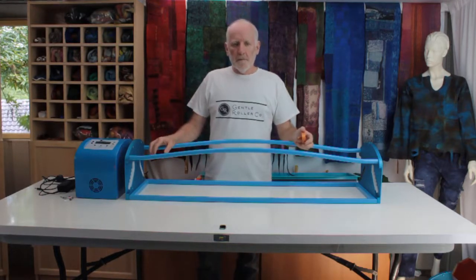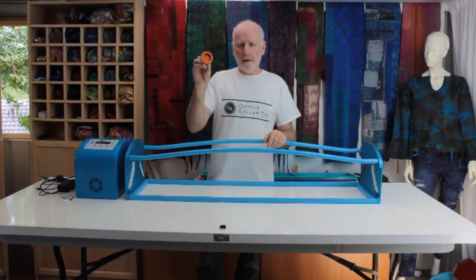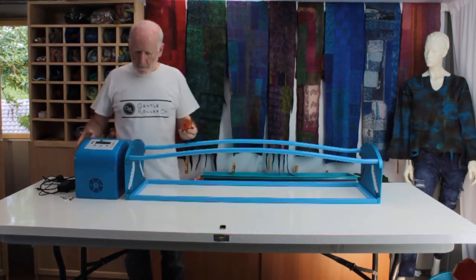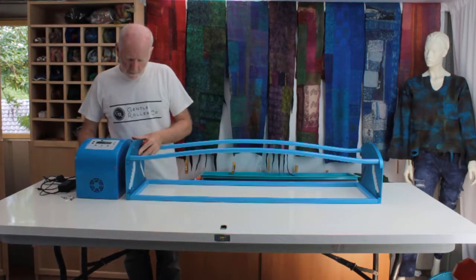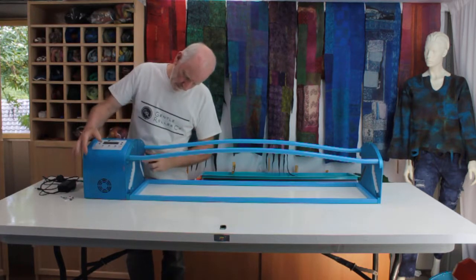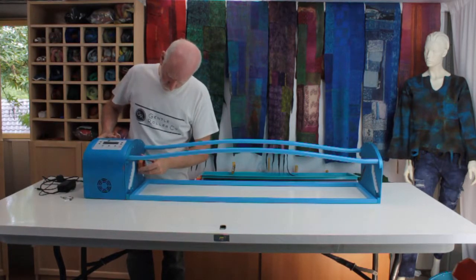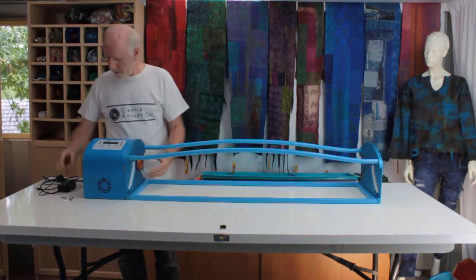One of the items within your assembly box is this hex plate, hex drive plate. To assemble the motor housing, just bring it together with your roller assembly. You can put the hex plate on before or after, but it's often easier to wriggle it on beforehand and get it in position.